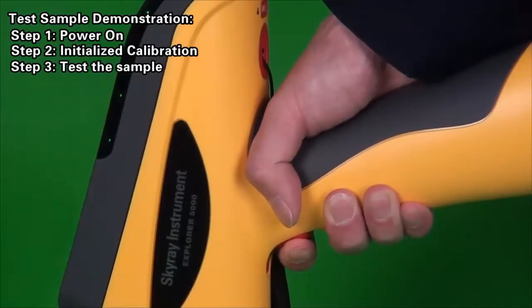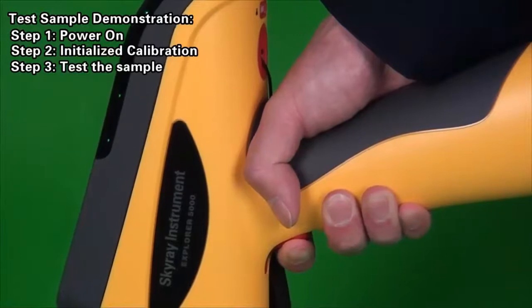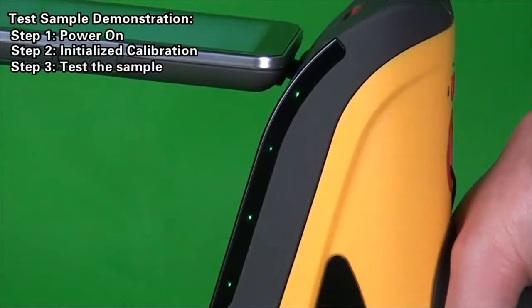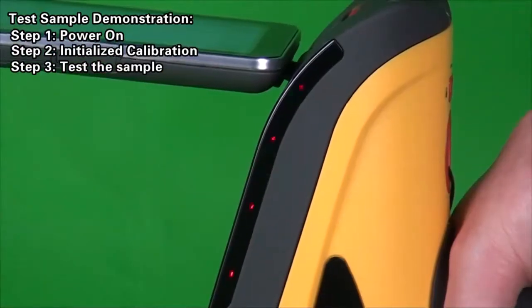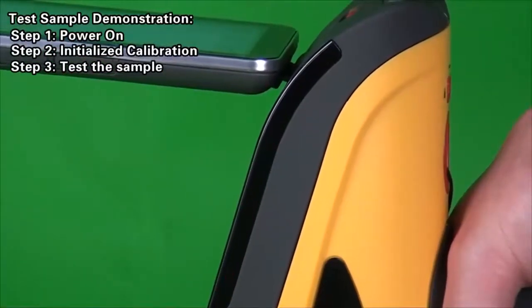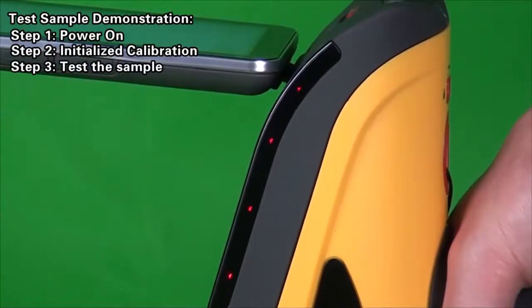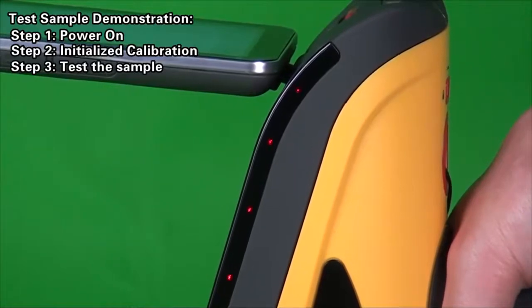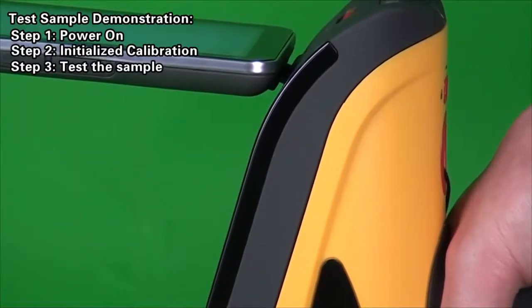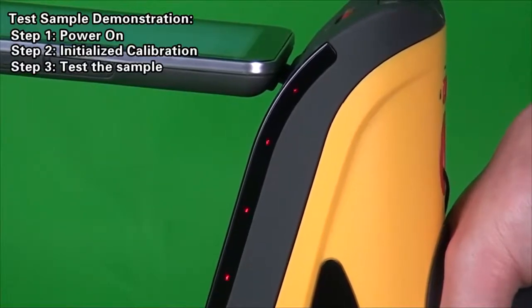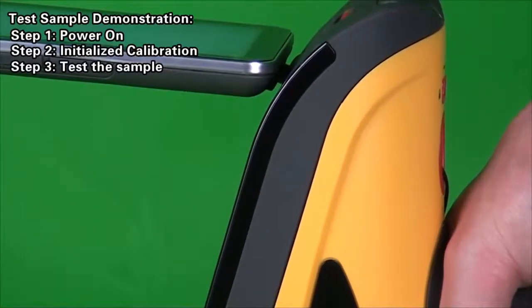In the process of test, the indicator light will change from green color into red flashing. The software interface will display the following steps and test results will be gradually displayed.